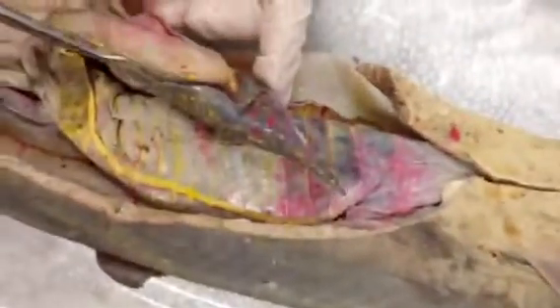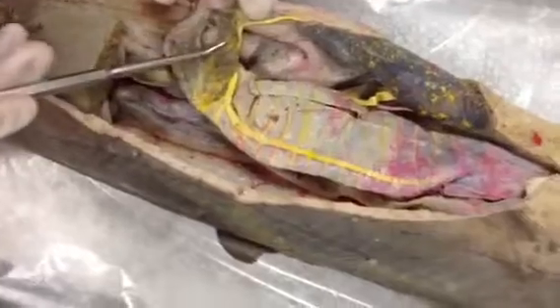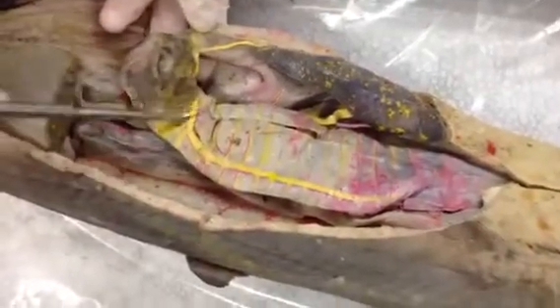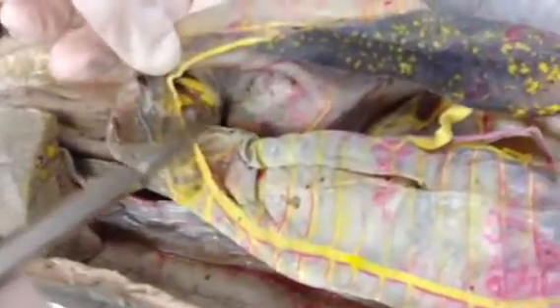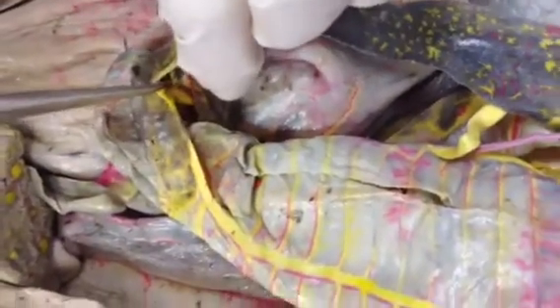The spleen is the triangular organ at the end or curvature of the stomach — this is the spleen. Don't confuse it with the pancreas. This is the ventral lobe of the pancreas, and the dorsal lobe is underneath it. They're connected by an isthmus, and they also have their own duct — the pancreatic duct — that drains both lobes to the intestines.